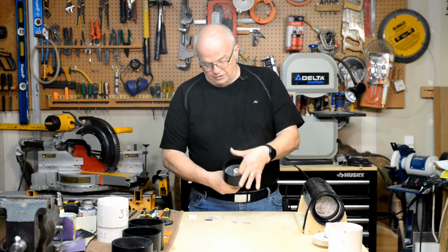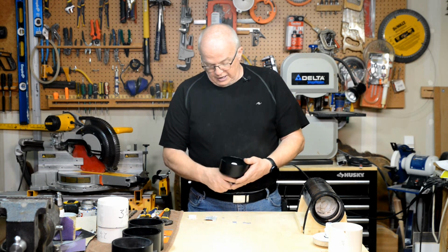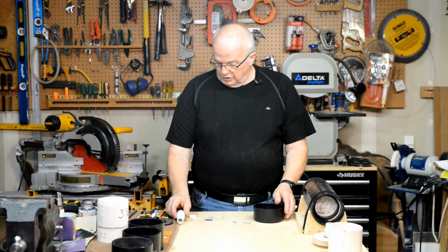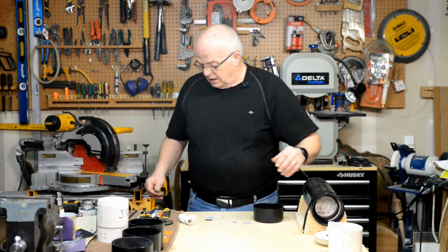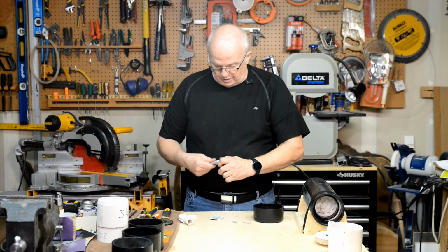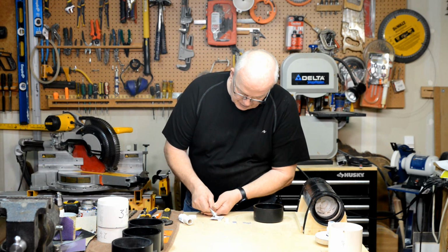And this is the longer one, so it's gonna come out a little bit further on this end. So what we're going to do is pretty much the same thing that we did with this one here. I'm going to mix up, only this time I'm going to mix up quite a bit more, because we're going to need a lot more.